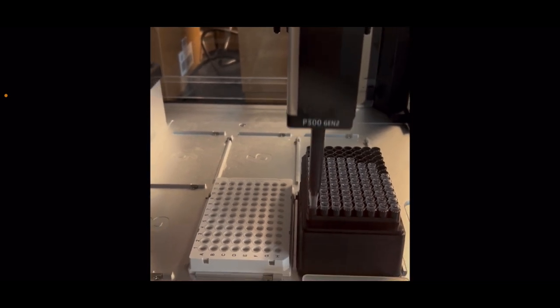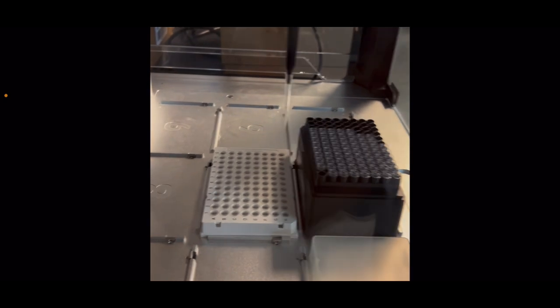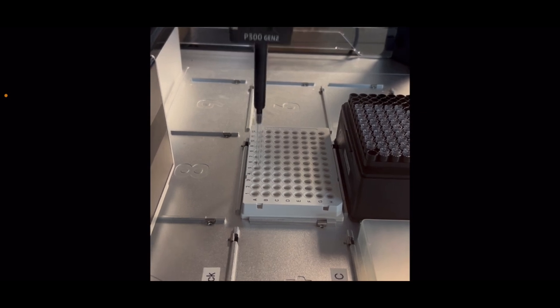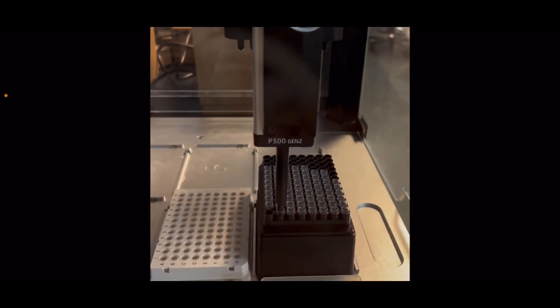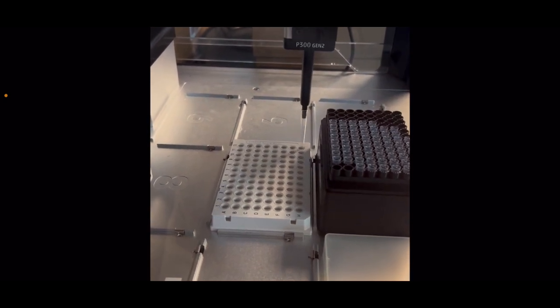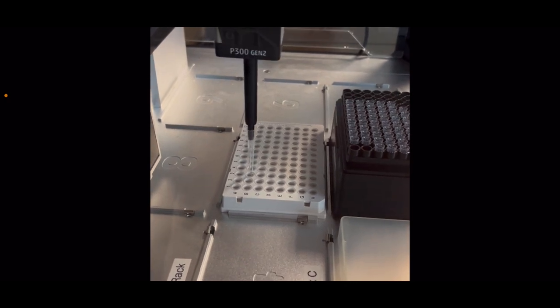This is the Opentrons taking it from H12, as you will shortly see, and then pipetting it into A1 to A5. Now it's taking it from H12 and it's going to pipette it to B1 to B5. 5 microliters, that is.